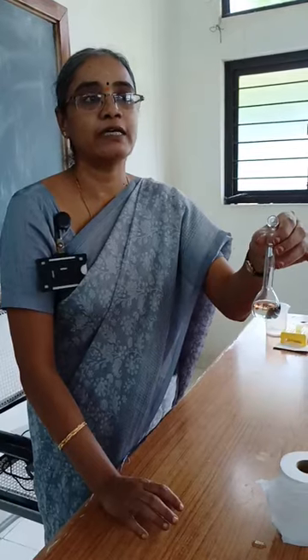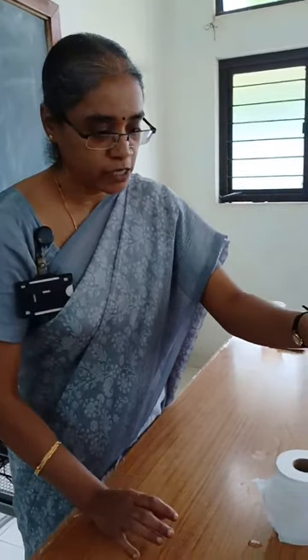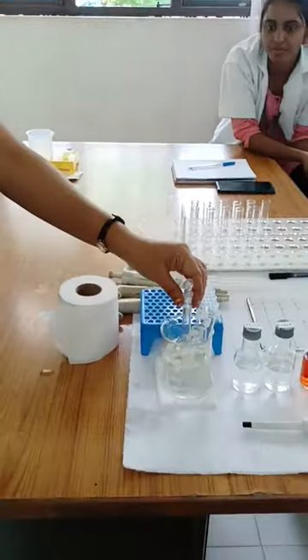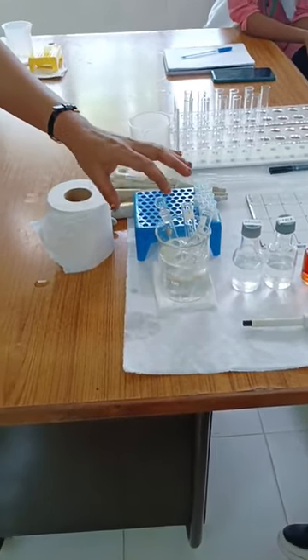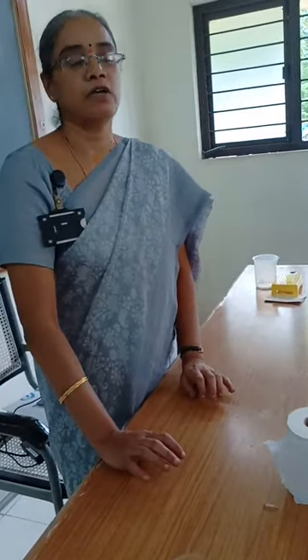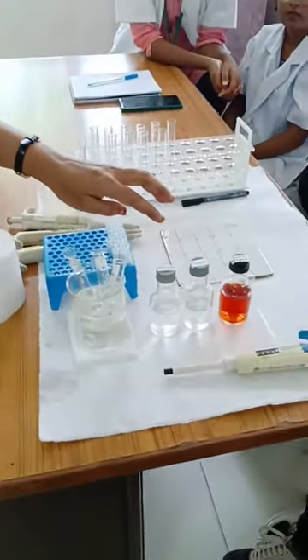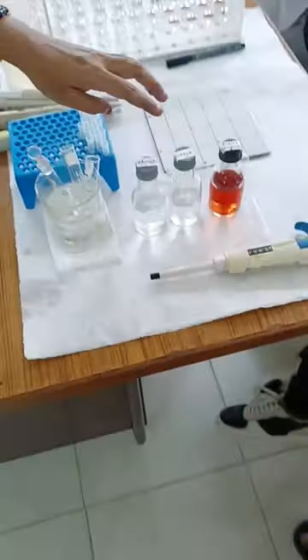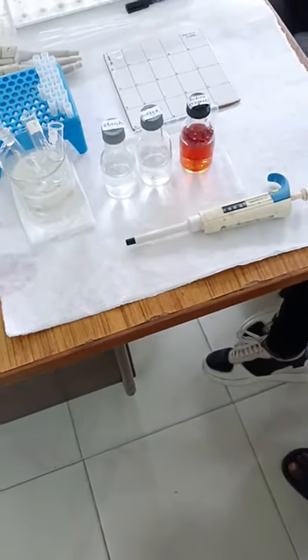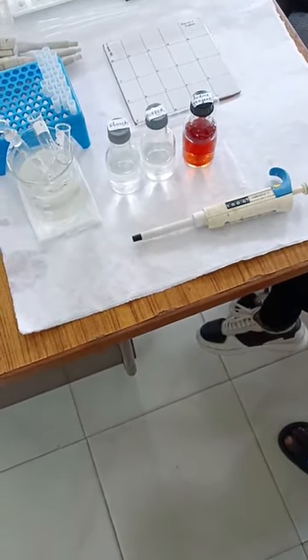Since it is an enzyme, the stock enzyme is being kept inside ice so that enzyme activity will not be lost. The other requirements for this achromic point determination experiment are starch — we have taken 0.5% starch — and a phosphate buffer at pH 7, 20 millimolar strength.